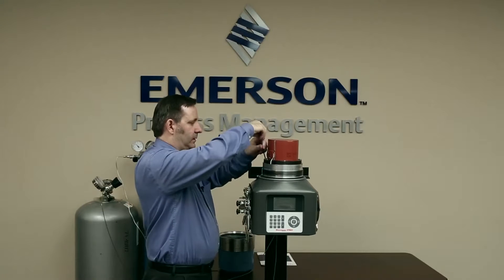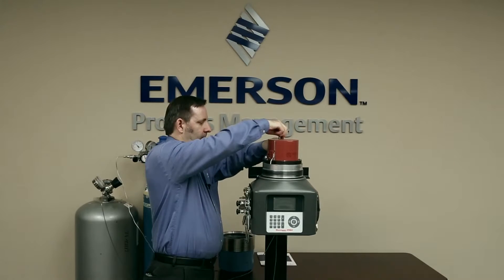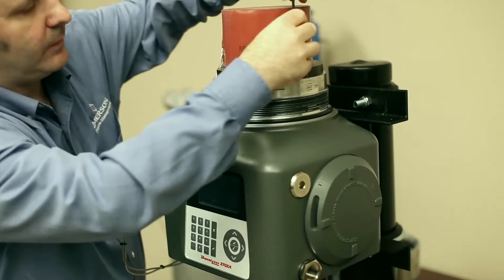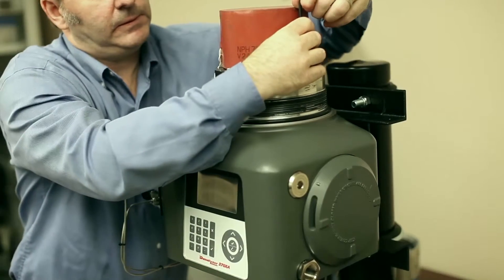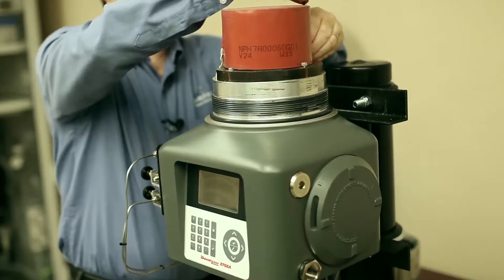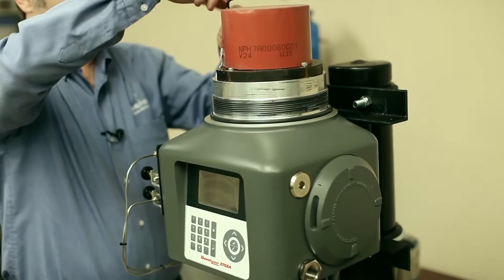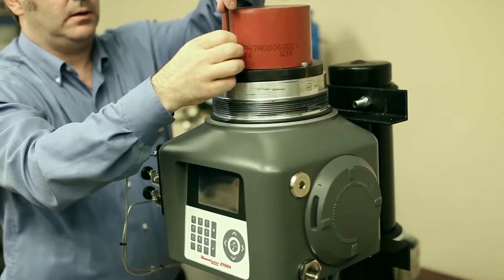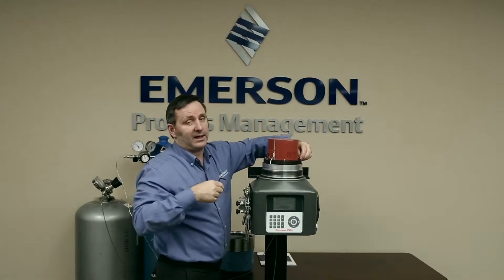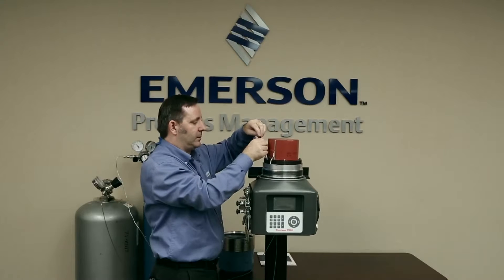Using a four millimeter hex wrench, I'll just loosen the screws first. Now as you loosen it, you might hear some pressure escape — that's the carrier gas and whatever sample may be left in the analytical components just venting. If you do loosen this and hear a constant flow of gas, it means you've probably left the carrier gas or sample gas on. You want to quickly turn that off.